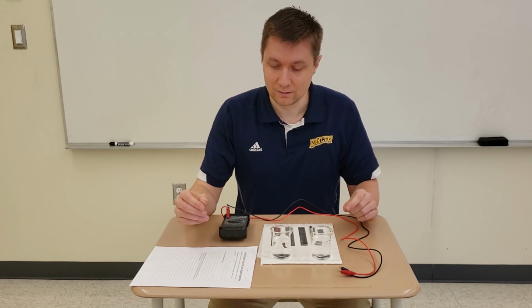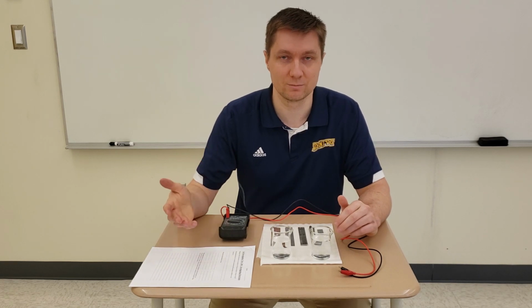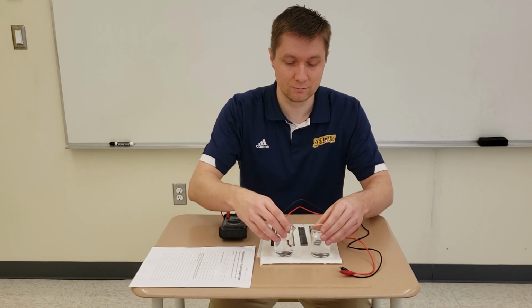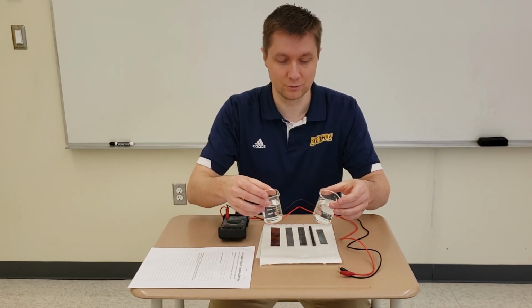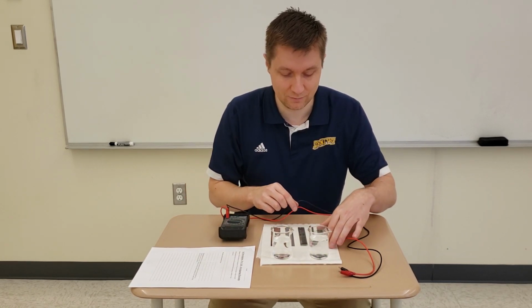Once you've done that, then what you can do is you can go to your materials list in your booklet as well, and there's a place there where you can list out all the various materials that we have in the experiment. So I'll run through those with you, and again, if you need to pause the video to keep up, that's okay. So we've got two 100 milliliter beakers here. We also have two electrolyte solutions, one acid solution, one salt solution.